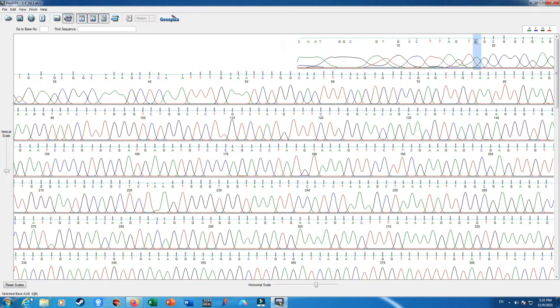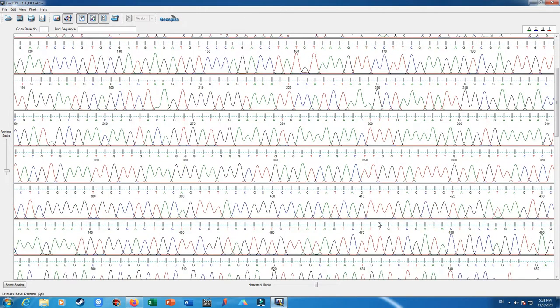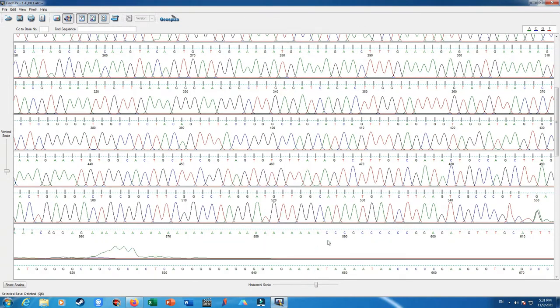The previous nucleotide, adenine 18, is Q8, which I do not want, and therefore I decide to remove this stretch of base 18 nucleotides before the guanine with the quality of 18. So hit delete, and let's trim the end of our sequencing.